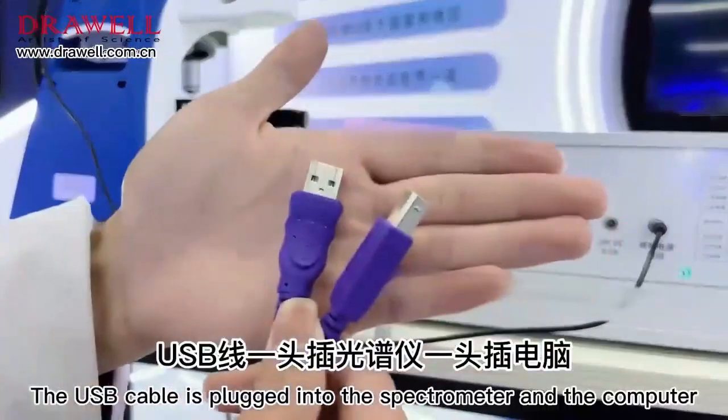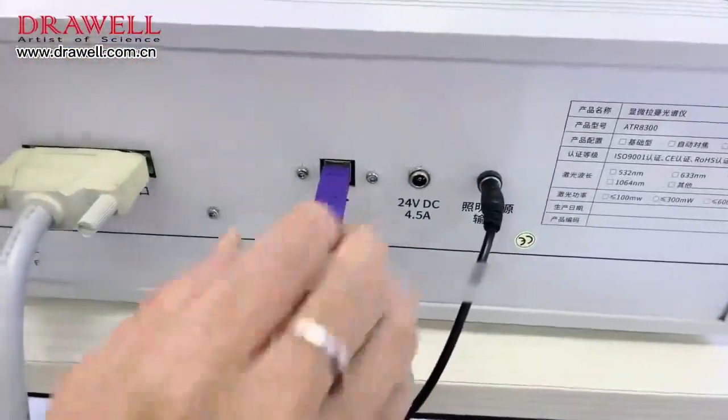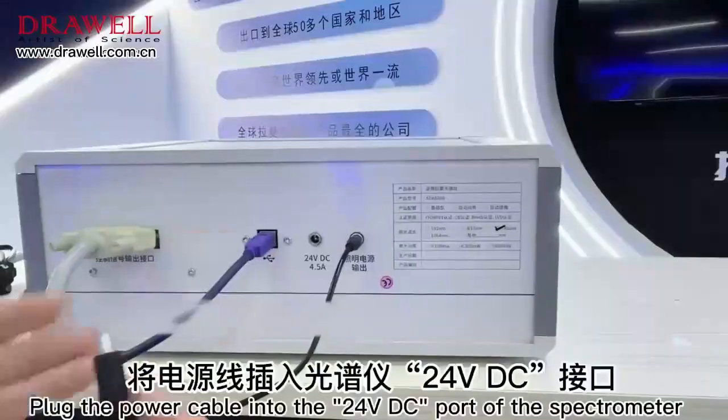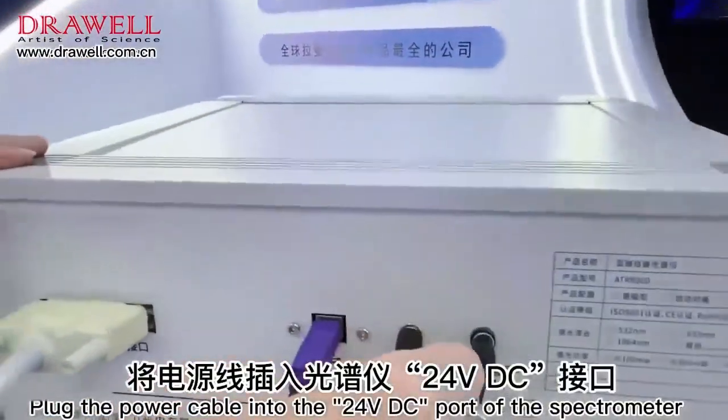The USB cable is plugged into the spectrometer and the computer. Another USB cable connects one end to the microscope and the other to the computer. Plug the power cable into the 24V DC port of the spectrometer.